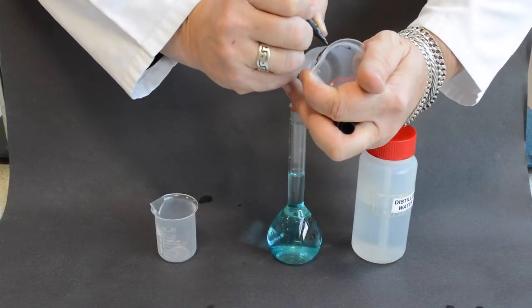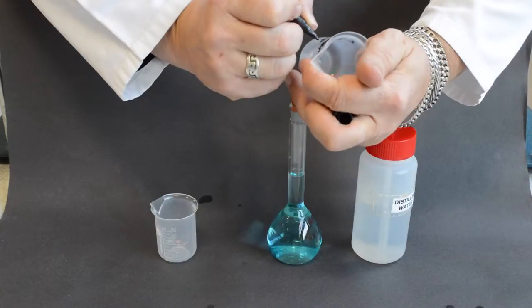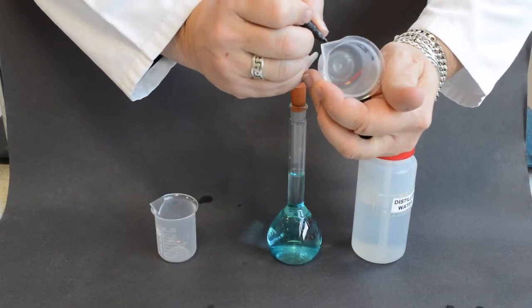As part of good general lab practice, label all beakers and vessels used accurately.